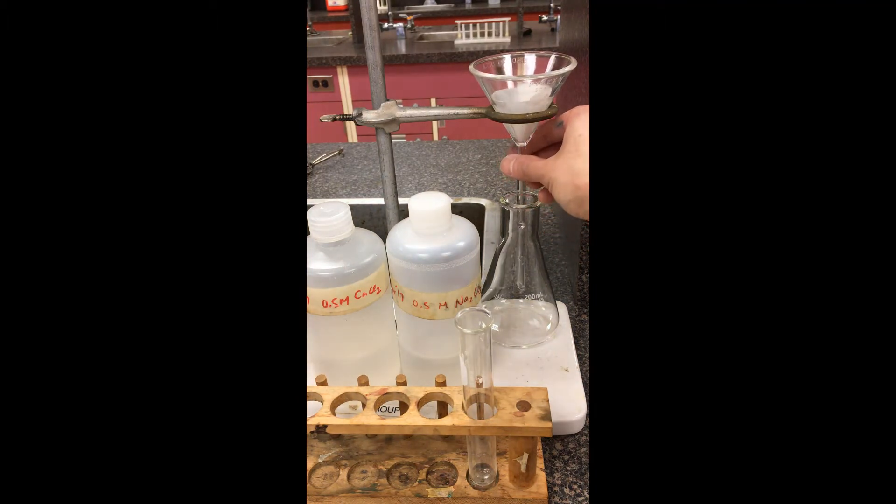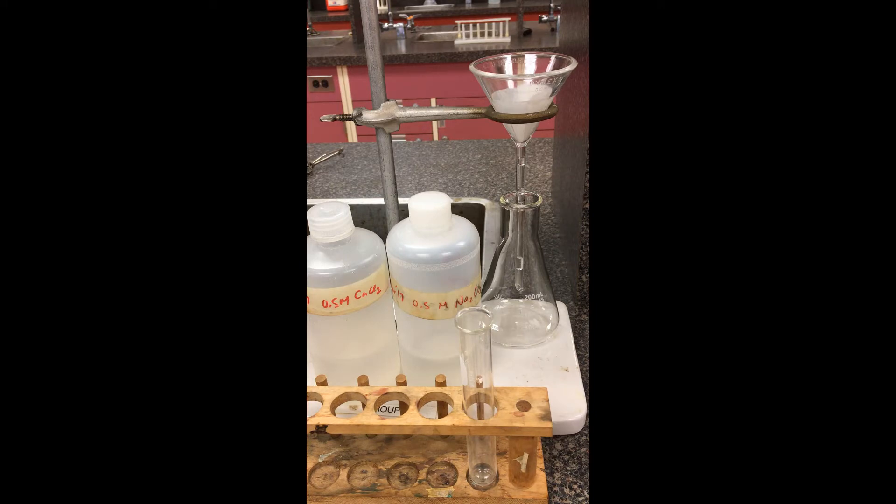Eventually, once I've collected up the residue, I'm going to wait till that is dry again. I'm going to weigh that afterwards, and then by subtracting, I can figure out how much we've collected.